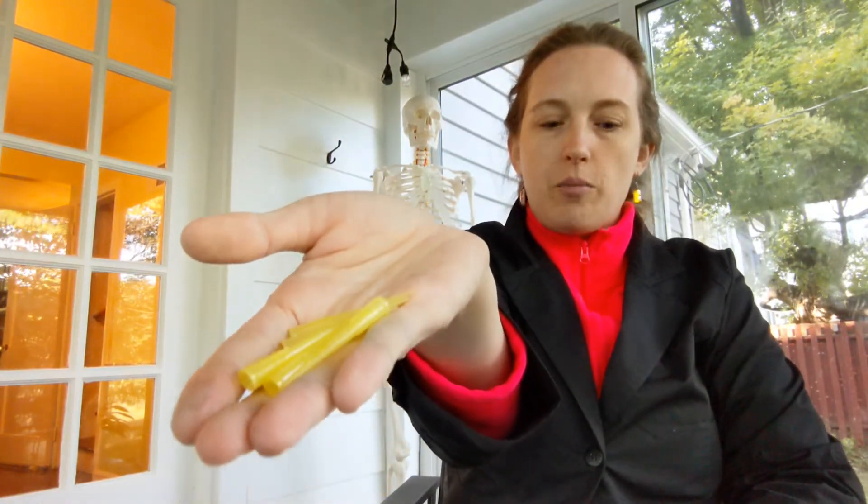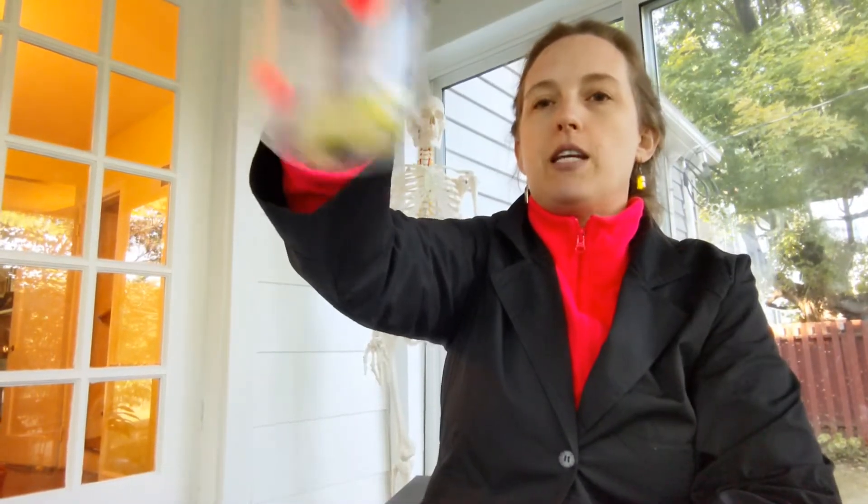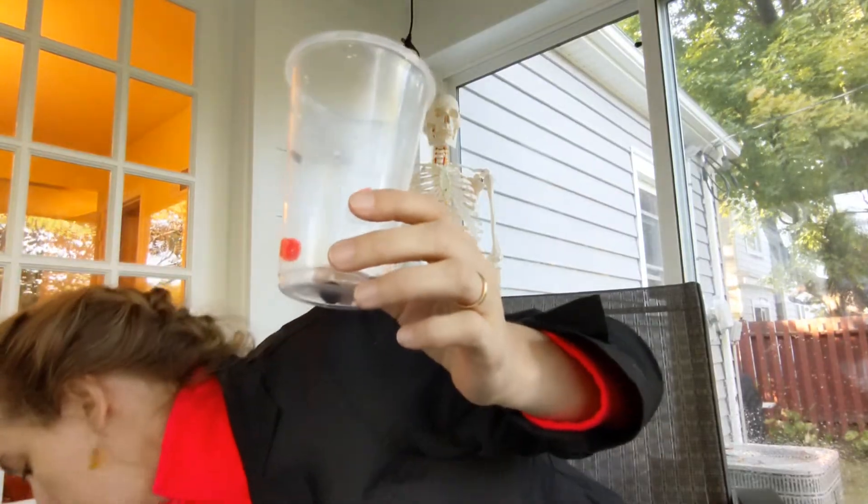We added the samples and maybe there's antigen stuck. The next step is to add another chemical called the primary antibody. I'm representing the primary antibody with some micropipet tips. I'm going to add them to the first sample, rinse with buffer, and see if anything sticks. Doesn't look like any primary antibody stuck — but of course, I couldn't see that with the naked eye, so for right now these would all look the same.